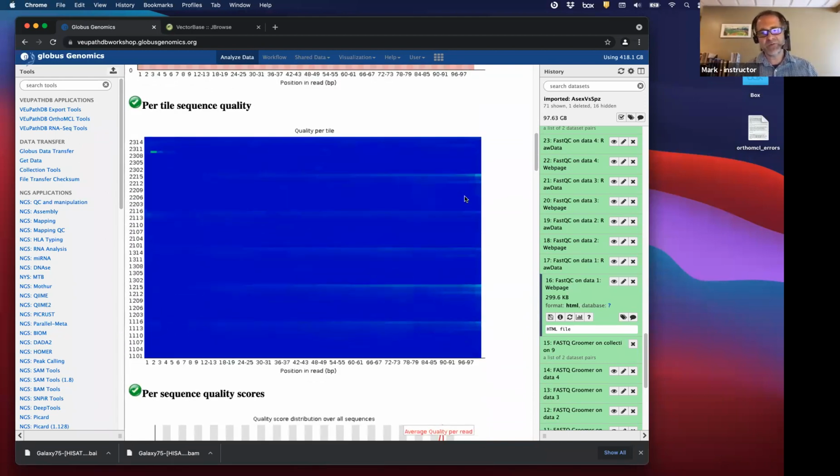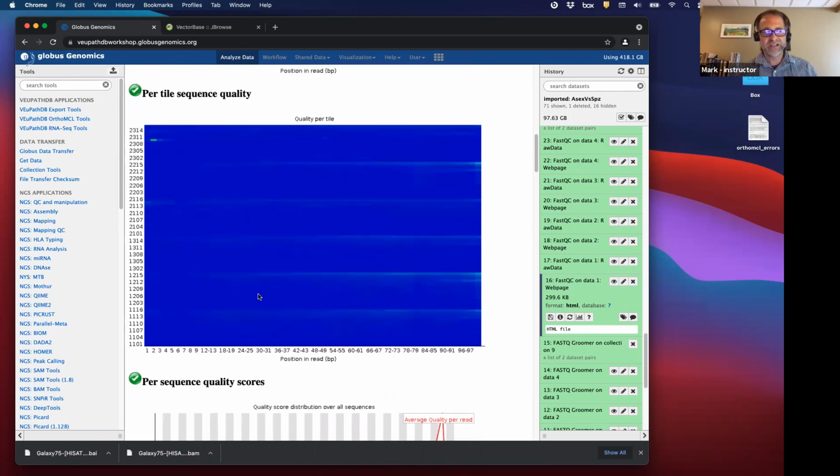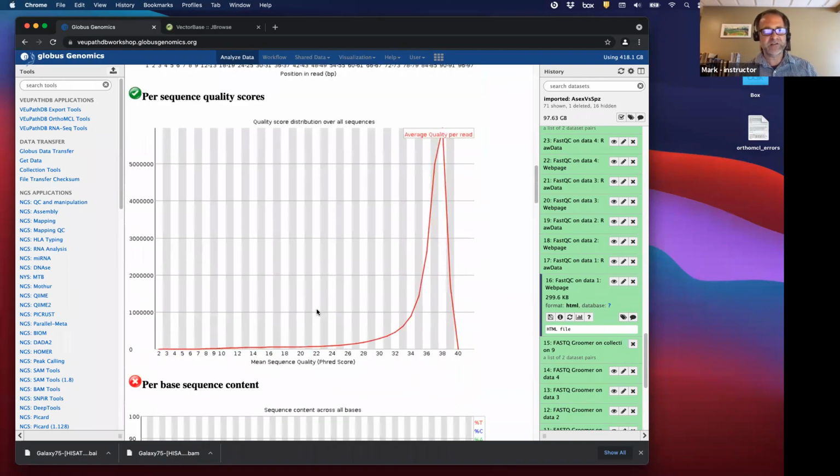And then I'm just going to quickly mention these. The per tile sequence quality has to do with artifacts from the flow cell of the sequencing technology, and it identifies problems in each lane of the flow cell, and there doesn't seem to be any major problems. So the quality in general is really high across the reads in every lane of the flow cell. Per sequence quality scores, that looks good. Basically, the mean sequence quality for all reads is around 38, which is a really good score.